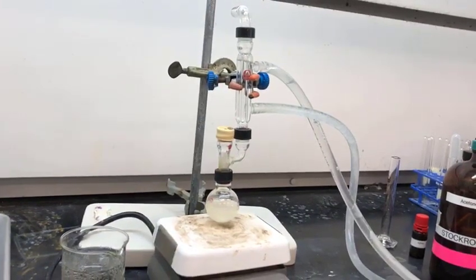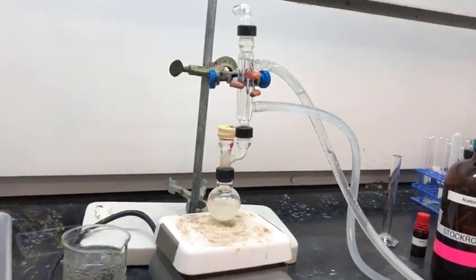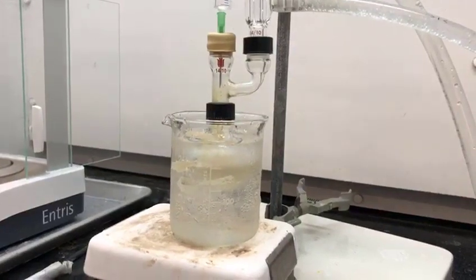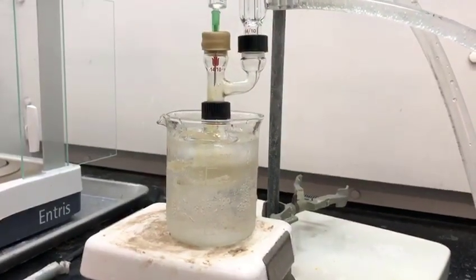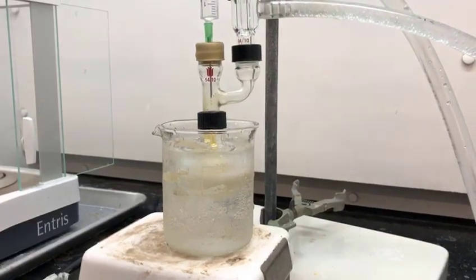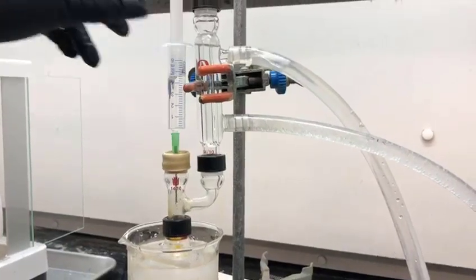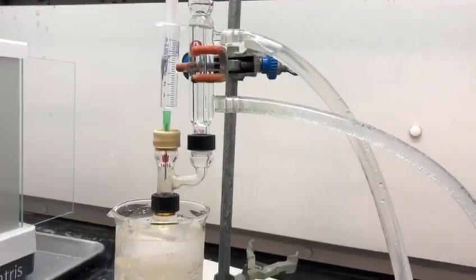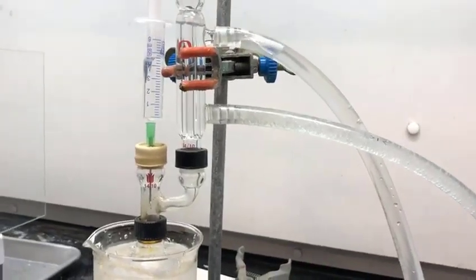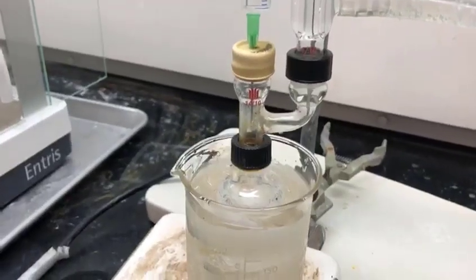So now at this point we are ready to go on to step 10 for our week number one procedure. Here you will see that we have added the ice bath back, so our reaction mixture is in the ice bath, and we are slowly going to add 5 milliliters of distilled water via syringe injected into the septum.